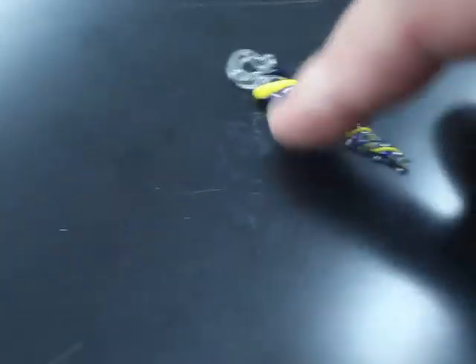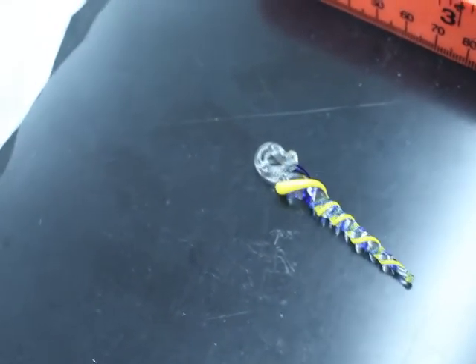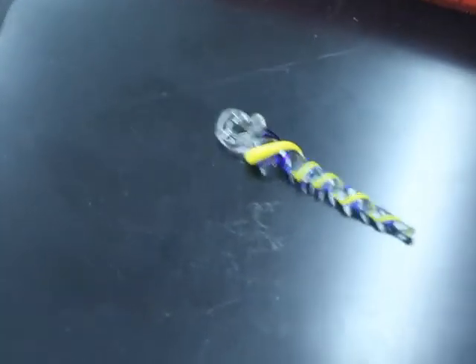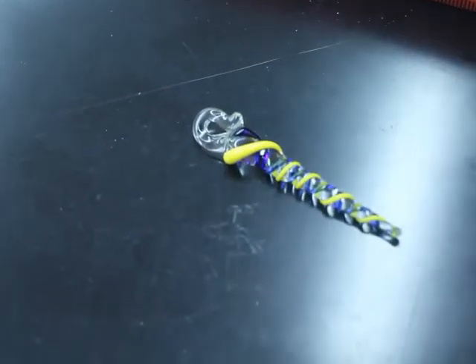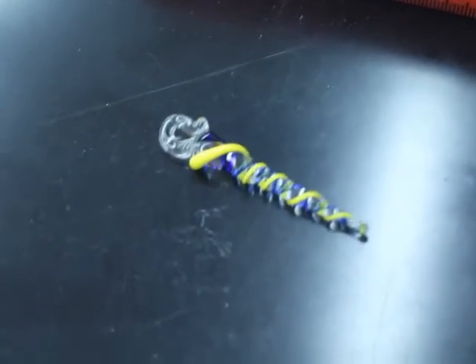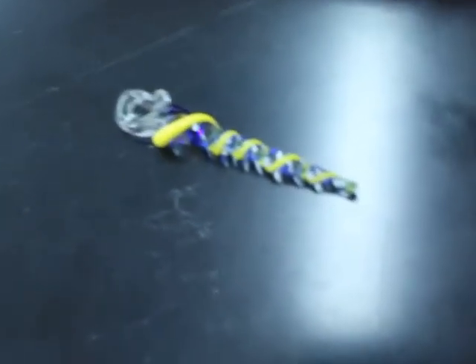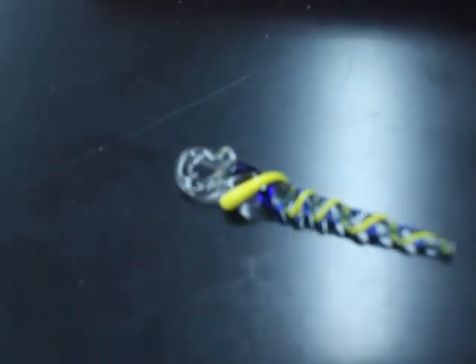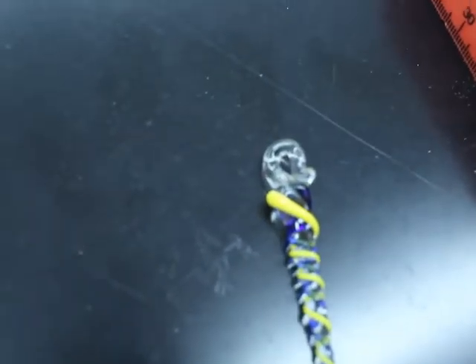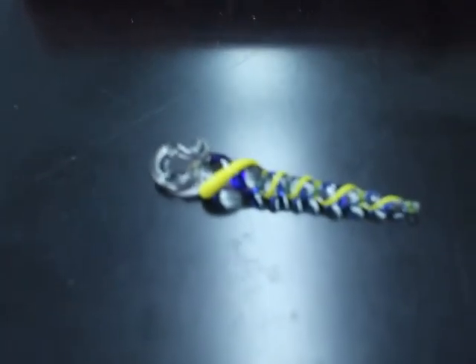Because if you can make a shepherd's hook like this, then you'll be able to do lots of other techniques in scientific glassblowing that require moving the molten glass, and doing it in a way where you're confident and have control. So take the time and learn how to make the shepherd's hook. It's very annoying — from my experience I spent a lot of time failing at making glass icicles, and especially the shepherd's hook portion of it, but it pays off if you're persistent.